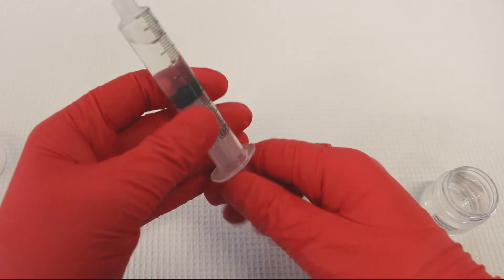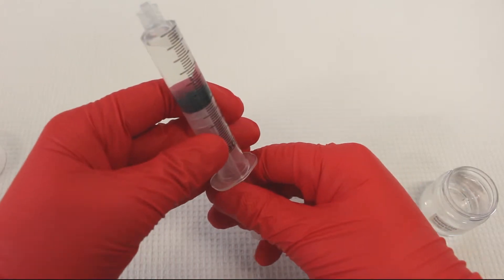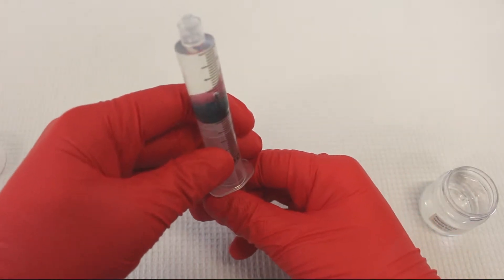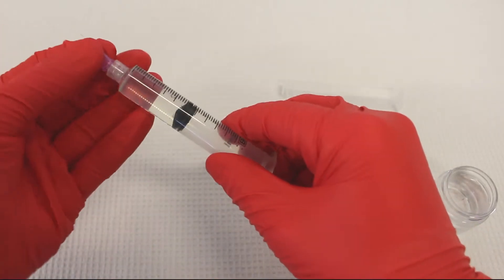Try to avoid air bubbles. Finally, add your needle.